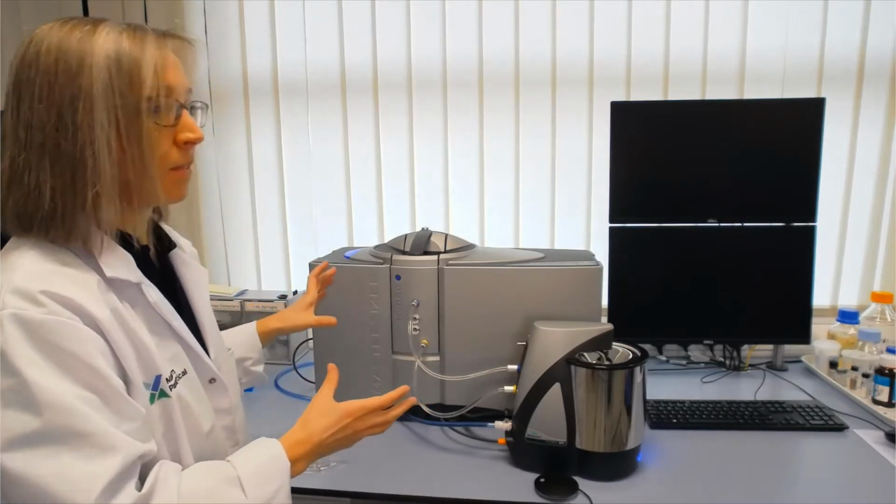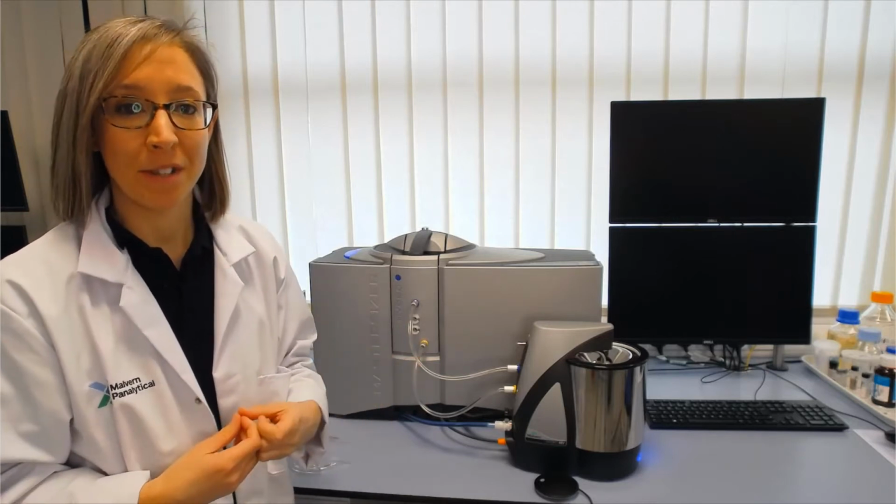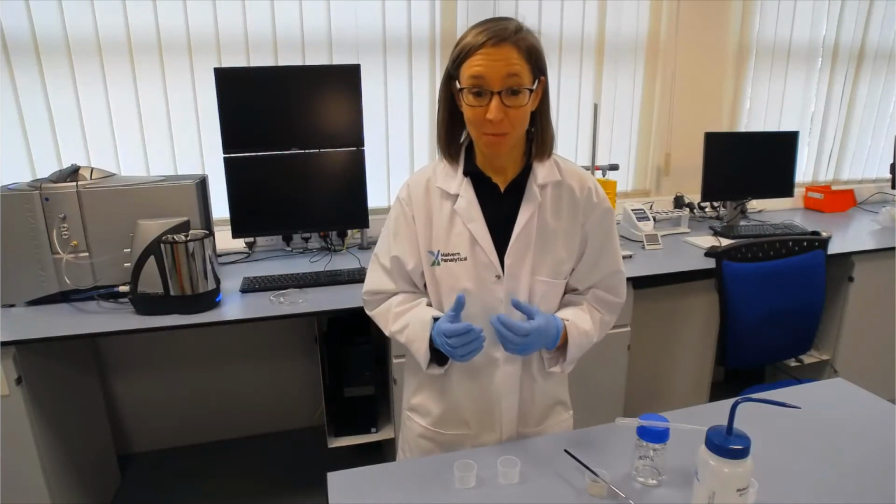So that should give you an overview of the hardware that we're going to use, and next we'll look at how we prepare the samples. So next I'm going to show you some sample preparation.